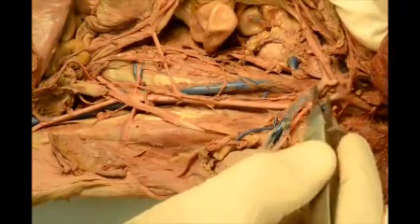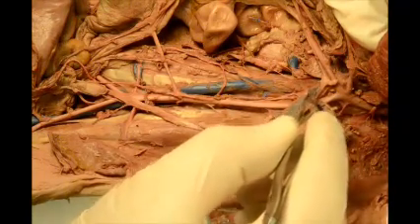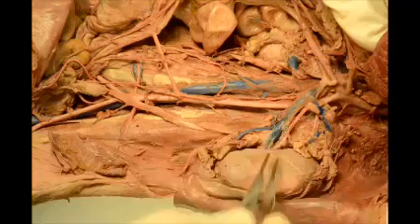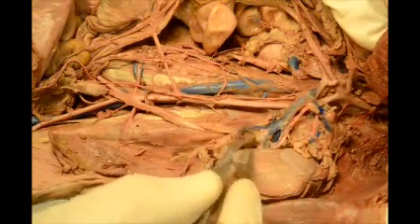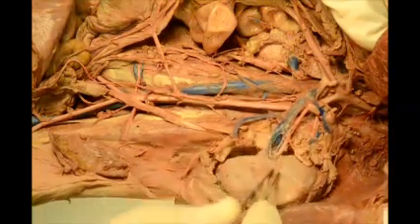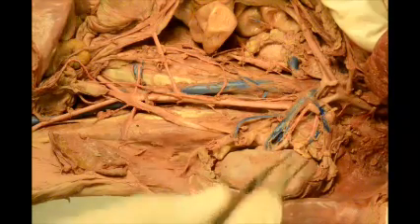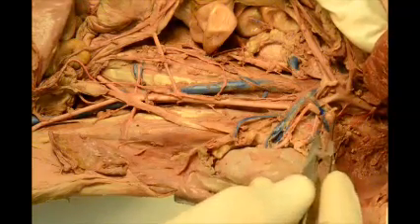I will start right here, the first one. That will be the large branch which goes into the kidney, which is over here. This is the left kidney. And that will be the left renal vein, which is right here. Sometimes the renal veins have multiple branches going into that organ — here's one, here's another one. And above it is the adrenal lumbar vein, which is here.